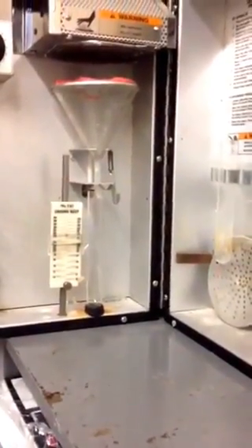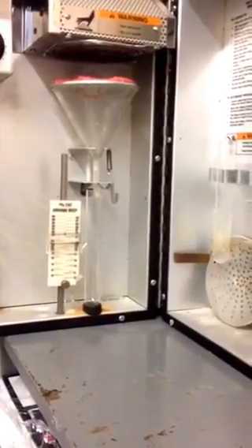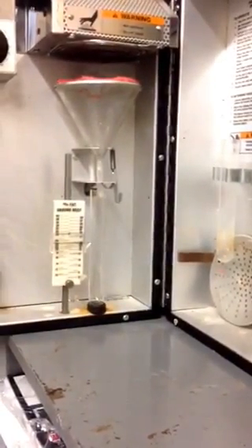I think it's about 15 minutes for it to cook. And then when it's all over and done testing, you clean it up.